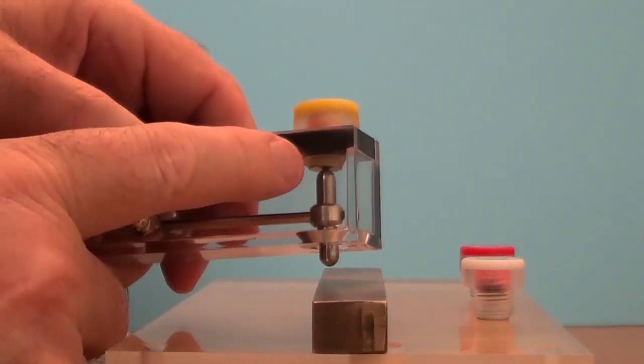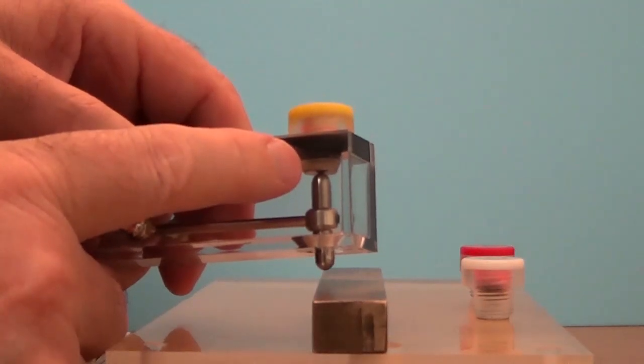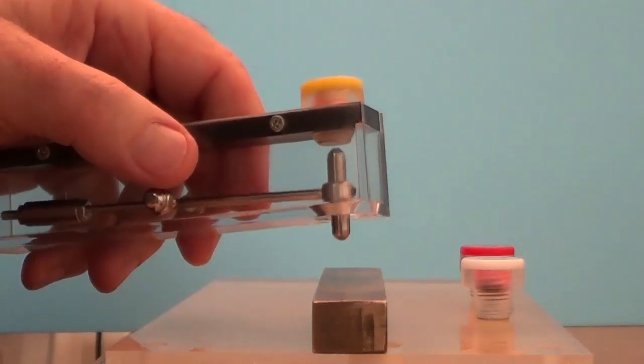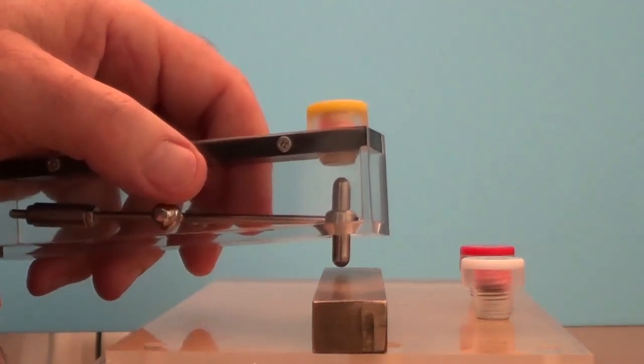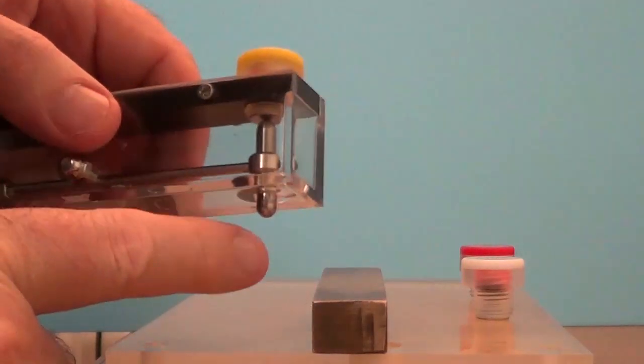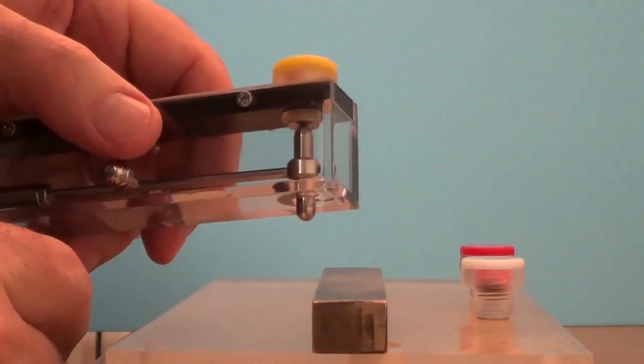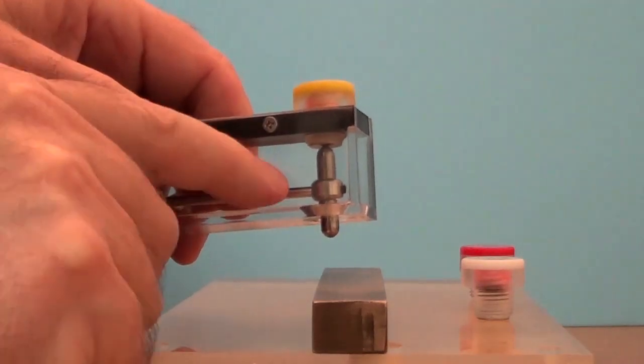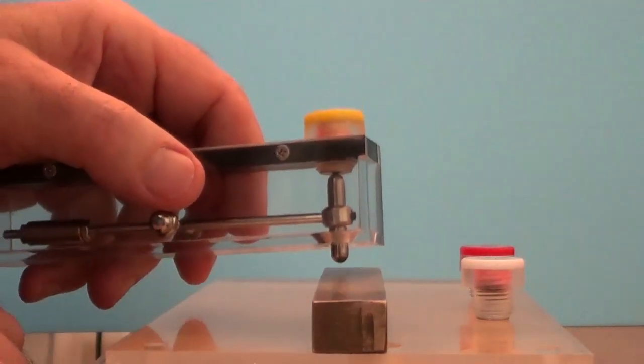What I'm seeing is that the bottom of the bar magnet wants to stay in contact with the sample and it pulls the top end of the bar magnet away from the calibrated insert. And the only reason that contact is broken between the sample and the bottom end of the bar magnet is because this collar comes down and contacts the bottom surface of this clear case.